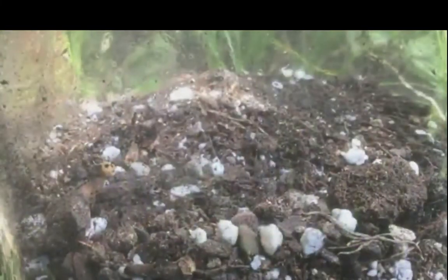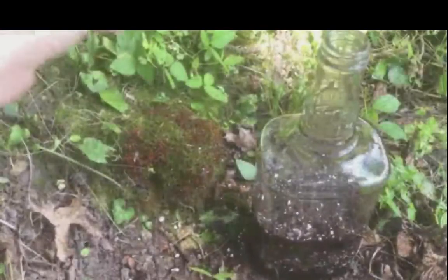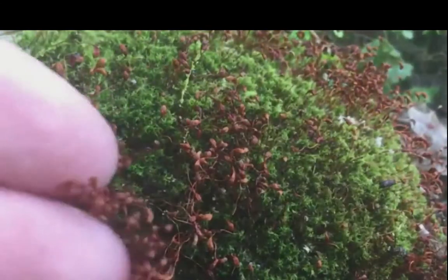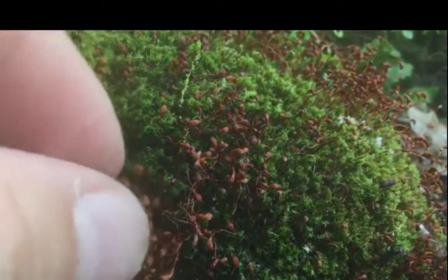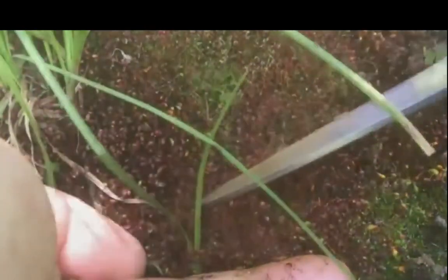And before we add our spores, I want to pre-moisten this soil. Now for the fun part. We get to add our moss spores. So I've collected most of these with the scissors, just to get those spore pods at the top. Just gonna grab a couple more here. I want to make sure I have enough for multiple different experiments.